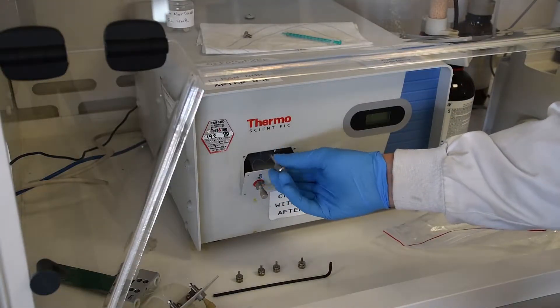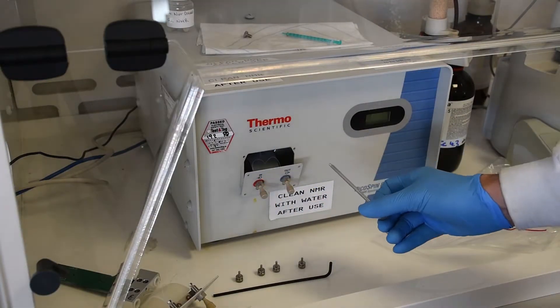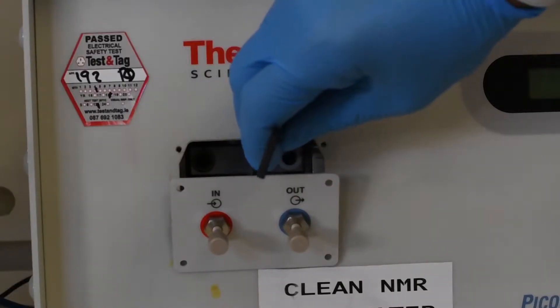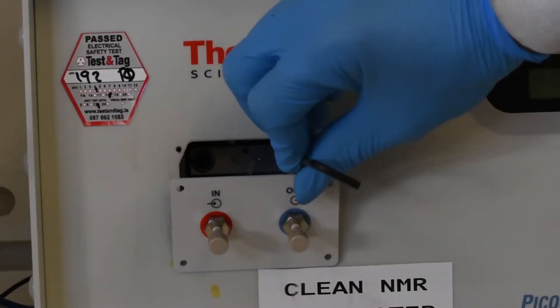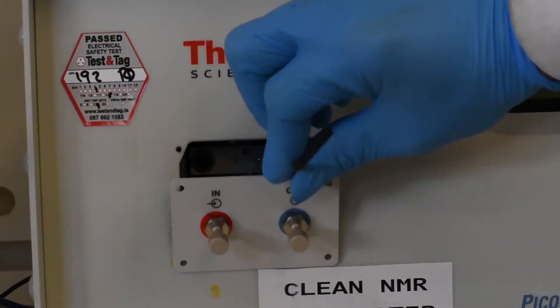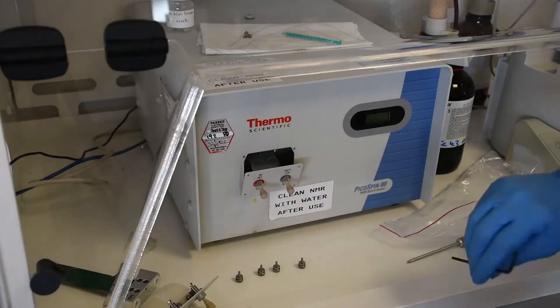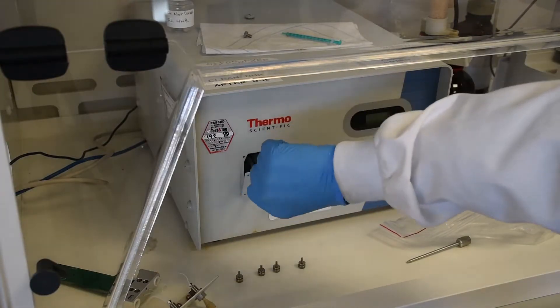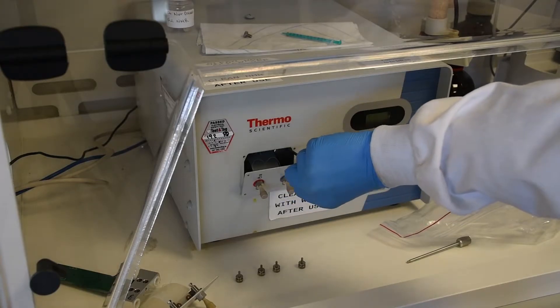Once you have got that in take out the screw, just gently unscrew it and then you want to tighten up the two bolts on the left and the right. The trick to this is to engage them first, tighten them up a little bit on each side and then work your way back across and back between the two of them so that you tighten it up evenly and you don't pull the cartridge to one side. Just tighten it in left and right.